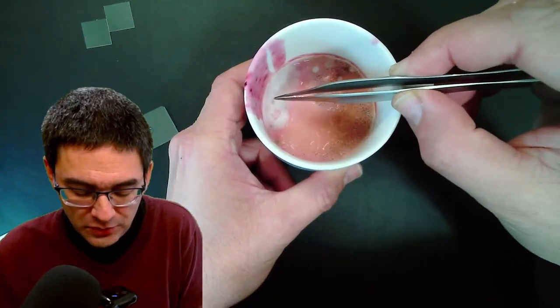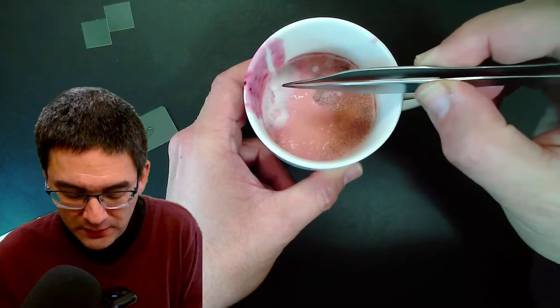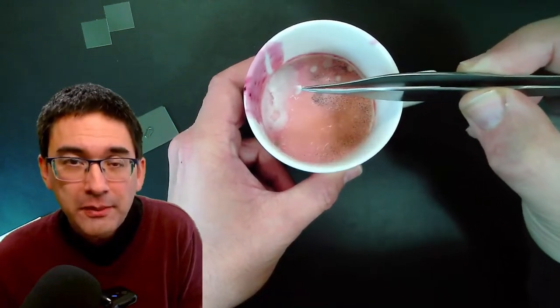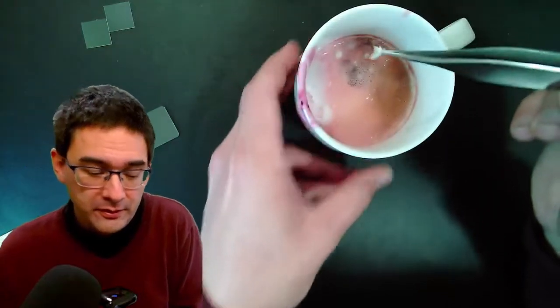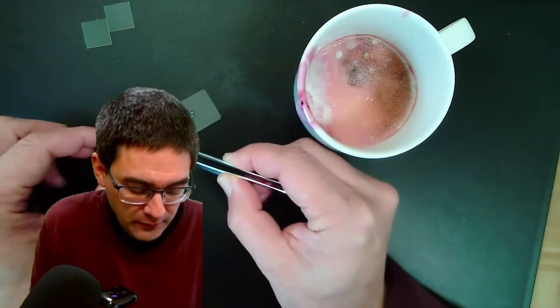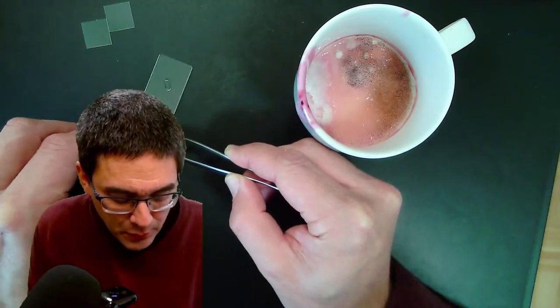If you want to use a safe source of fungus, I recommend that you get some cheese. Common brie cheese, for example, also contains a lot of this white fuzzy stuff. The mycelia, that is actually the main part of the fungus.